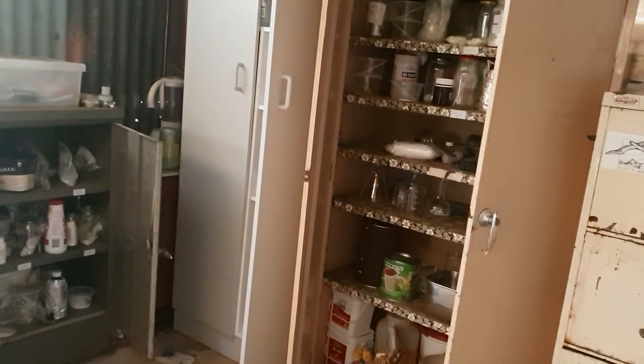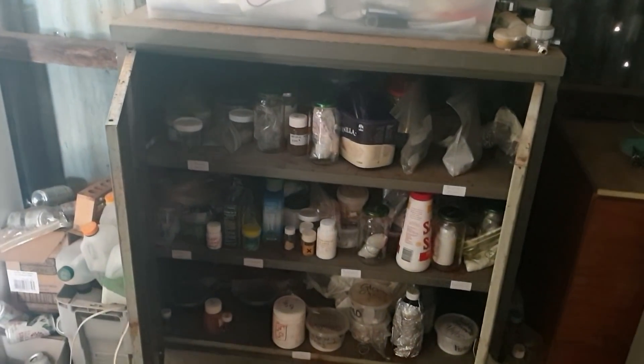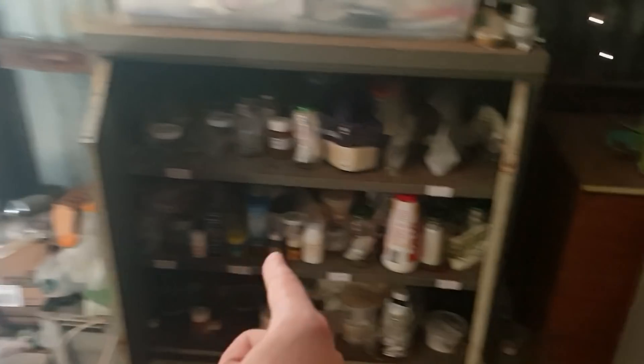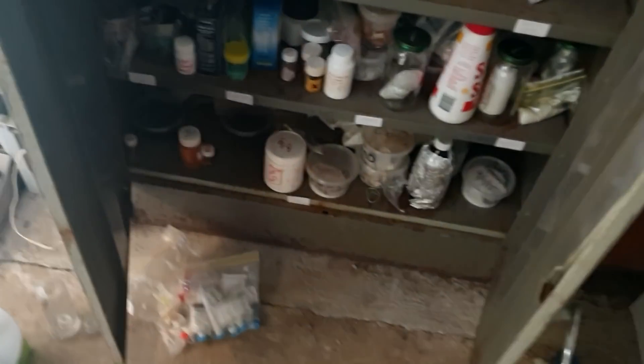There is some interesting chemistry. No one wants to watch videos of me painting. There are some easy projects - let's start with an easy project. The hardest part I think is going to be actually finding the raw materials. If I'm smart, I would have put it either there or here, and yes, it was actually where I thought it should be.